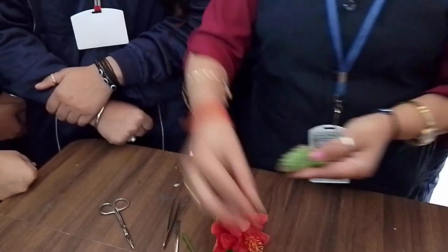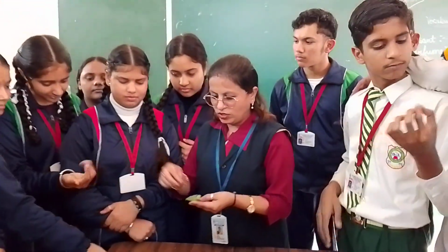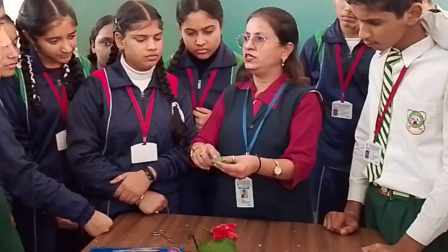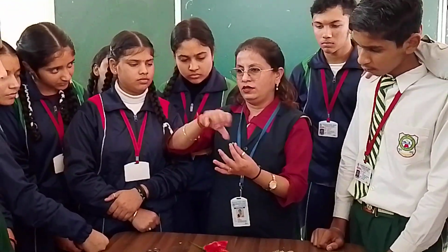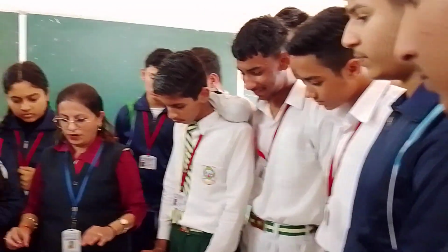So this is a leaf of your bryophyllum that we have discussed, that they are having buds. They are the small buds, you can see. These are the small buds which rise like this. So buds originate into other leaves, and it's a whorl of leaves, a group of leaves. Okay, so this is one part of the vegetative propagation.